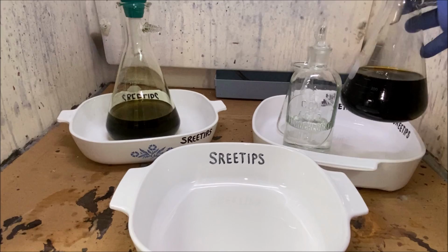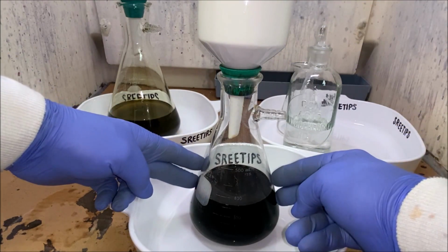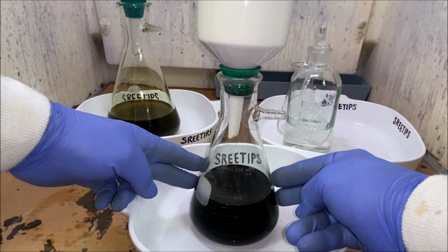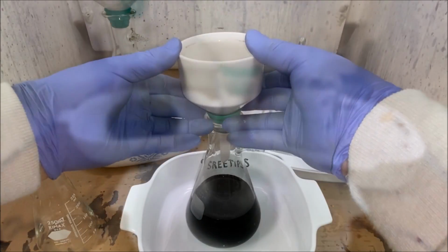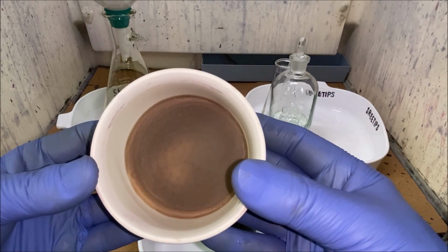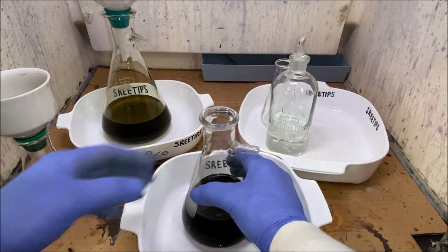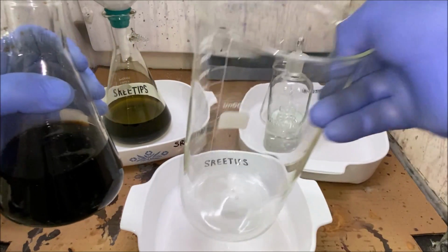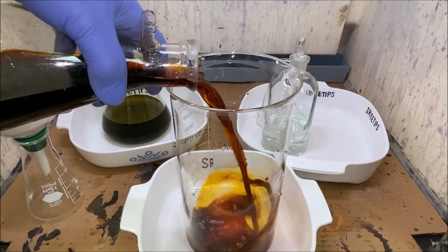This is our DMG precipitated palladium material. And this should just have platinum group metals in it. So this will be the easiest one to deal with. This will be the one we'll start with. Here's our filter. We'll add that to our paper storage. I'm going to get this out of the way now. We're going to add our palladium solution to a big beaker here. Looks like coffee.